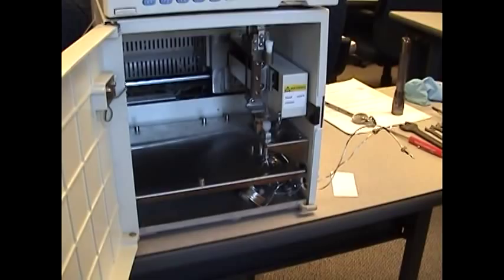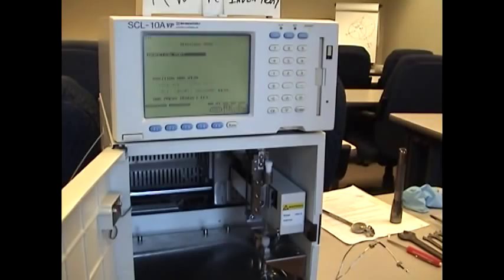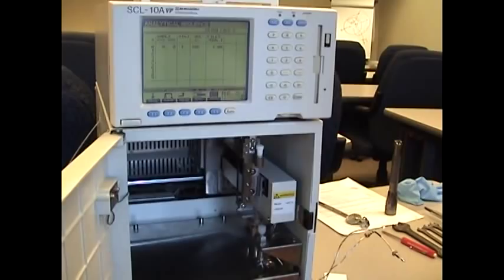When the needle is in its proper position, you finalize the settings by hitting enter. That will actually flash those settings to the circuit board and save it. Notice the auto-sampler will initialize.